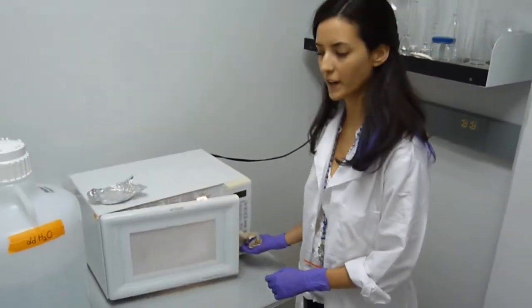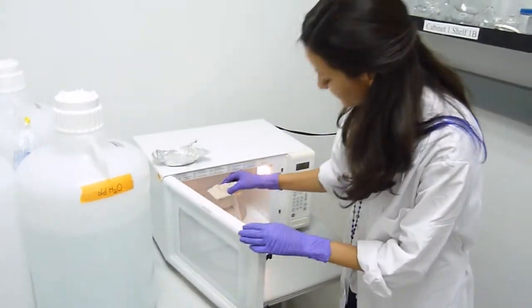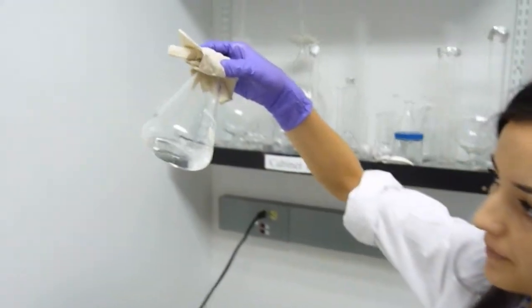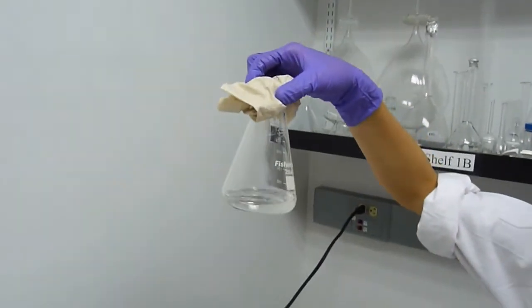Once again, we want to check our agarose. Take it out carefully because it is very hot. Swirl it and inspect for any particles. I can't see any more particles, so our agarose is ready.